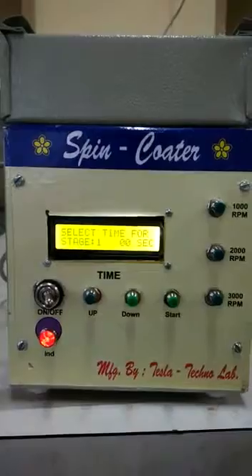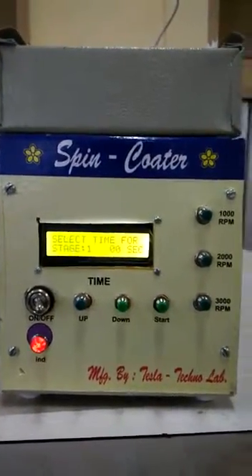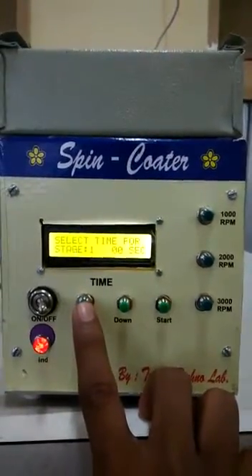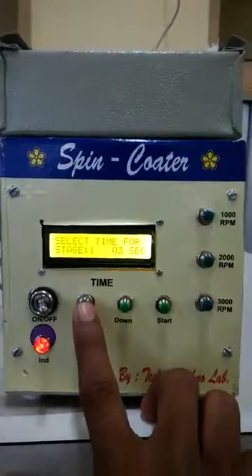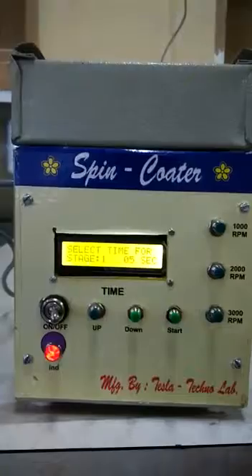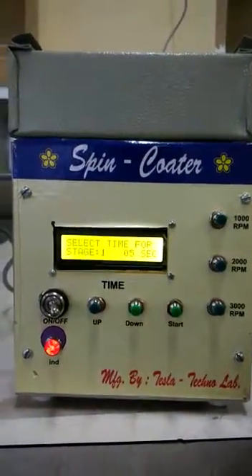Since it is a two-stage spin coater, you have to provide stage one and stage two timing. For stage one, I am giving a timing of five seconds. Stage one operates at a lower RPM of around seven to eight hundred RPM.